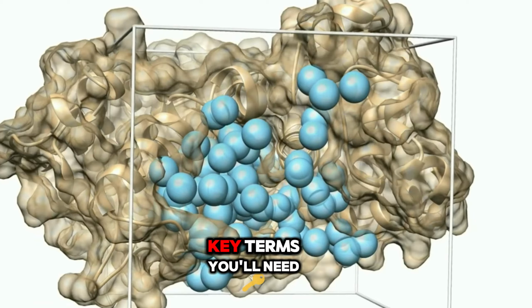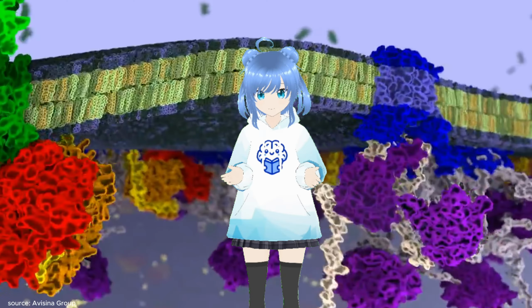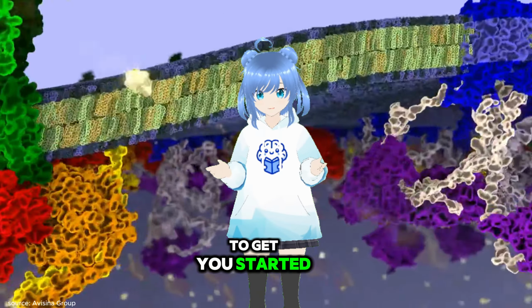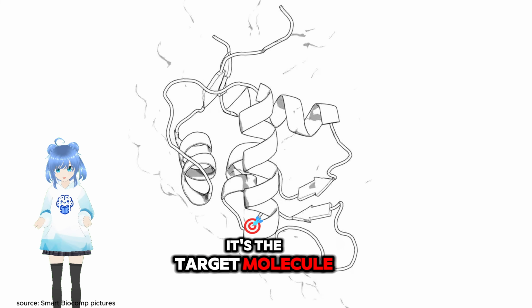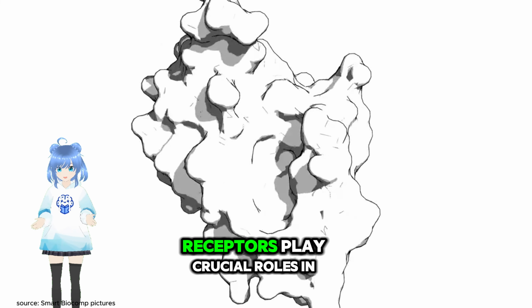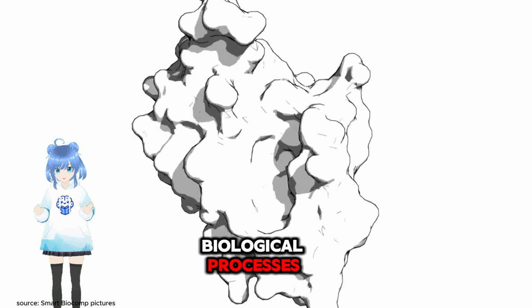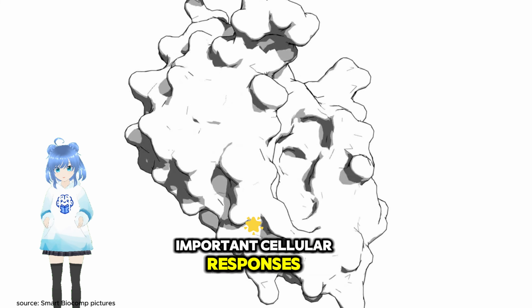Let's break down some key terms you'll need to understand before diving into the world of molecular docking. Here's a handy glossary to get you started. Receptor. Think of this as the lock. It's the target molecule, usually a protein, that the ligand binds to. Receptors play crucial roles in biological processes, and their interaction with ligands can trigger important cellular responses.